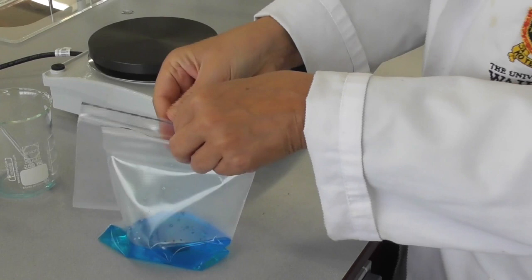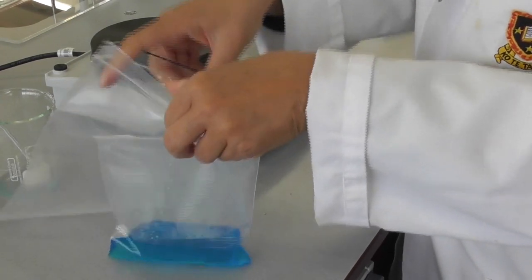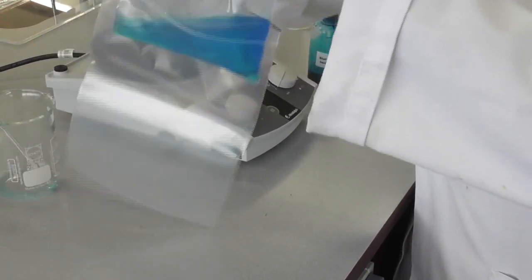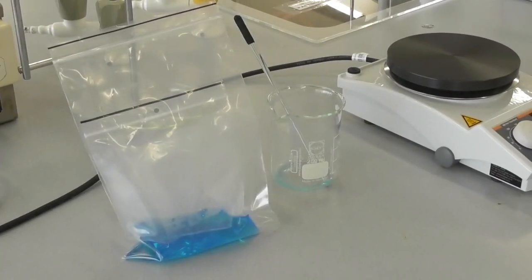For safety, we add this into a second, slightly larger bag. And then we let the solution cool off.